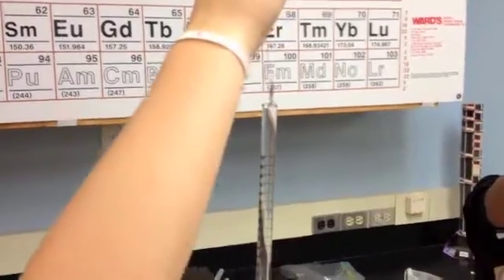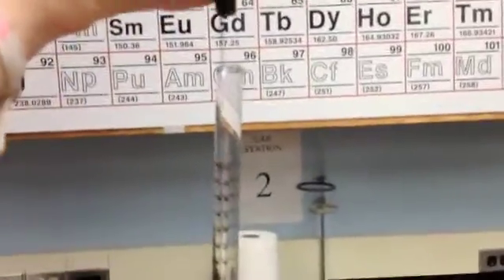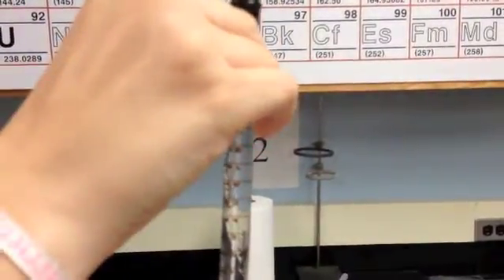I'm adding the 2.6 centimeters of magnesium to the solution. Okay.